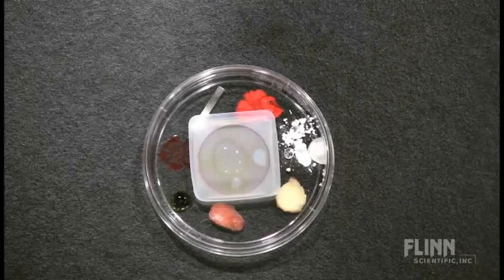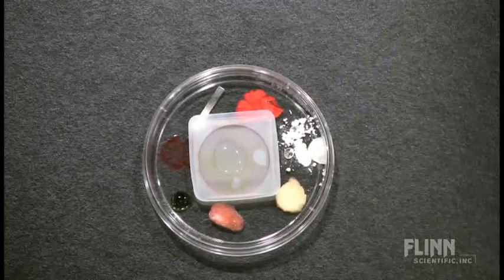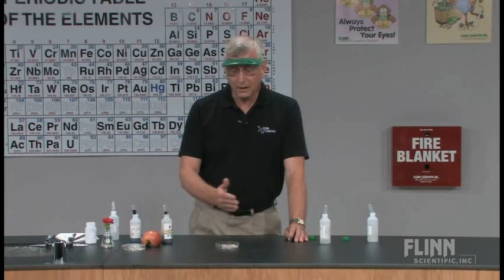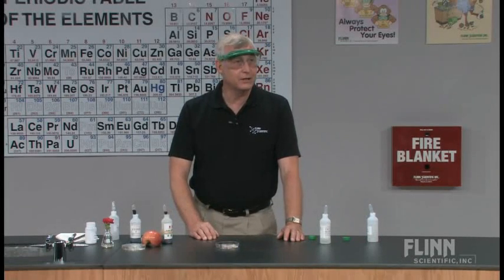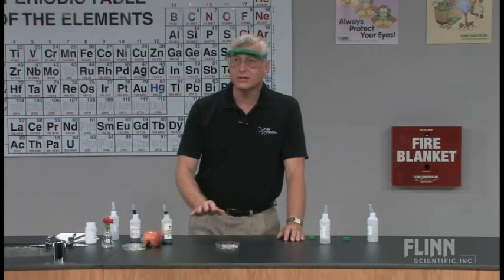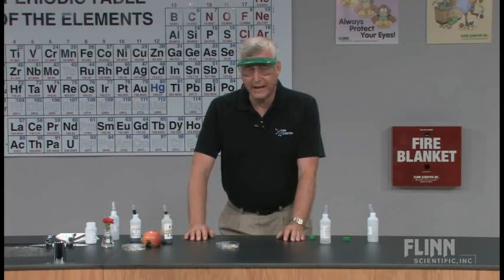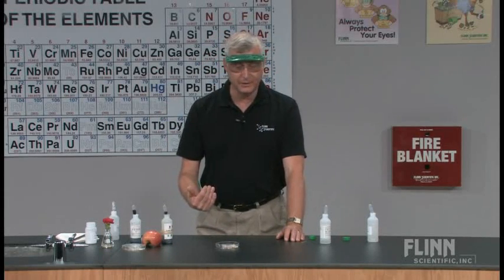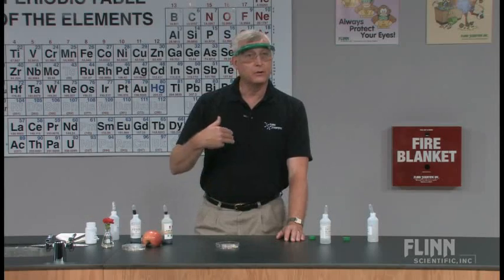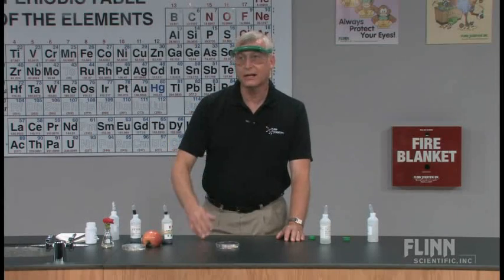While we wait for a couple of those changes to occur, let me talk a little bit about how I would set this up in my classroom. At the beginning of the period, students would come in, go into the lab station, and set this material up. It takes just a few moments for the students to do the actual mechanics of getting all of this in place. They would write down observations about what those materials look like to begin with, and then they would come back into the classroom area.